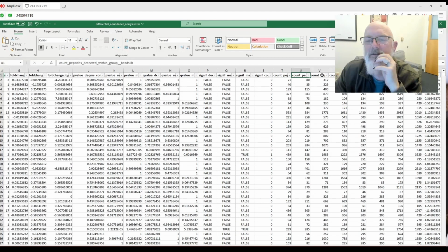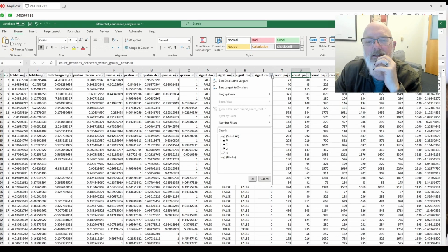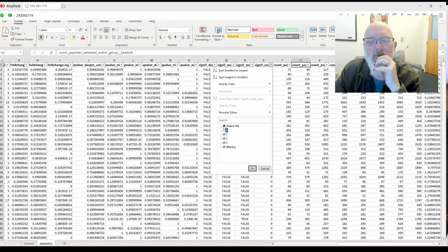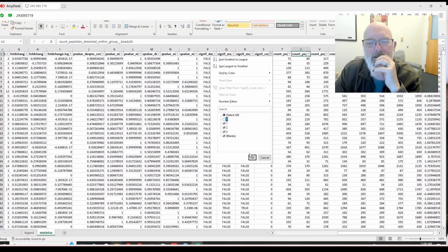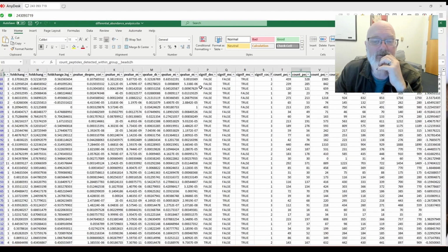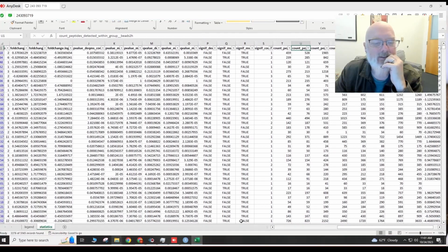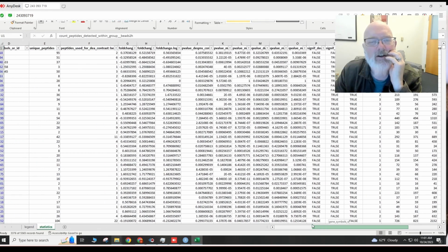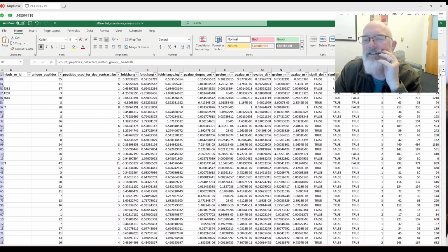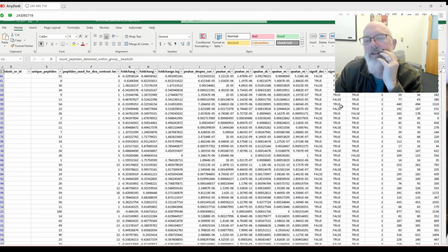Peptides detected within groups. Peptides. Oh, that's kind of cool. Gives you a z-score. So what I would do was I would filter this at least to 1 and see what that does. So that means at least one algorithm determines that it's significantly different. Is that good? I don't know. Maybe would you do 2 or would you select all 3? That's a good question. I don't know. I don't know if it's necessarily a good idea to require all 3 to be significantly different, but you could. In that case, you could say 2 out of the 3.